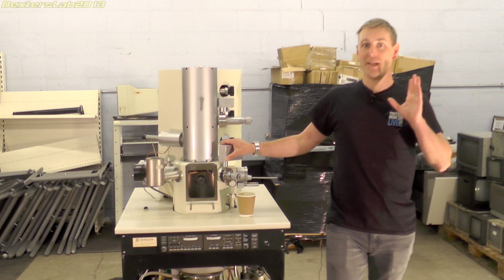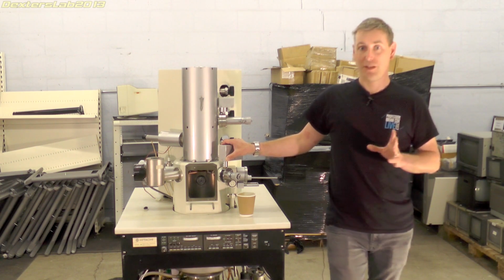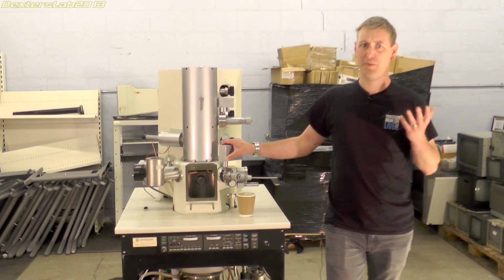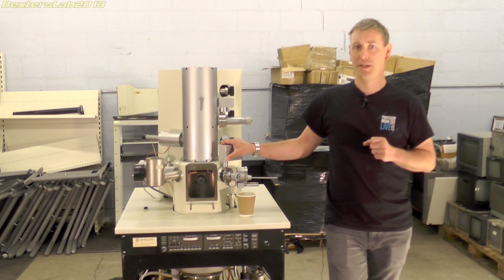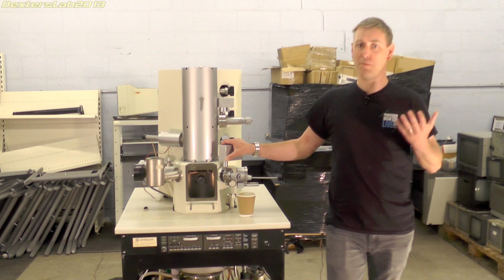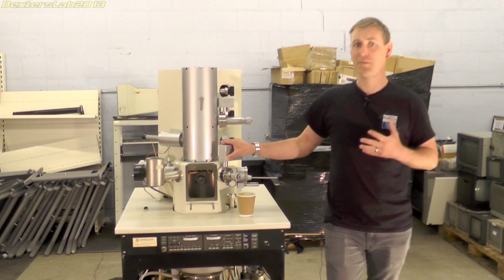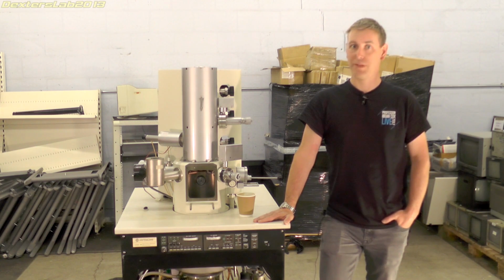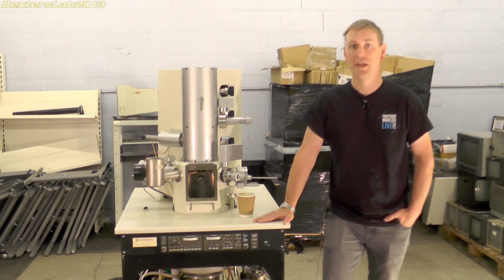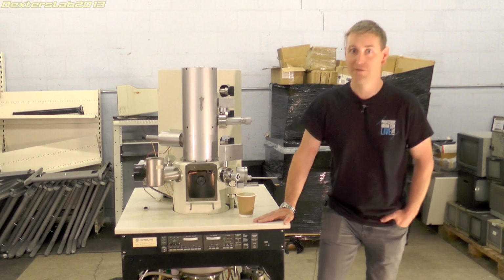This all means that you also need a high vacuum system as well as everything else, which would typically be made up of a roughing pump to evacuate the bulk of the air from the system, and then a further pump like a turbo molecular pump or a diffusion pump, and possibly additional pumps like ion pumps. This brings the vacuum down to around 10 to the minus 7 torr. You also need high voltage for driving the electrons around.